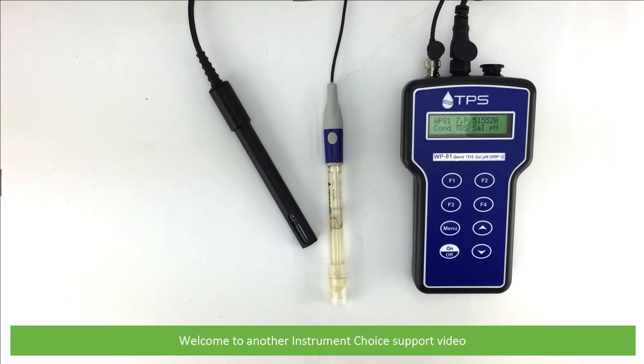Hi and welcome to another Instrument Choice support video. In this video we'll demonstrate how to calibrate conductivity and pH on the TPS WP81 pH wide-range conductivity TDS ATC and temperature meter, starting with conductivity.